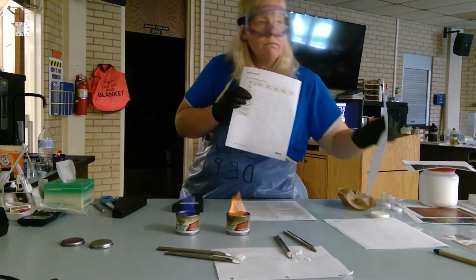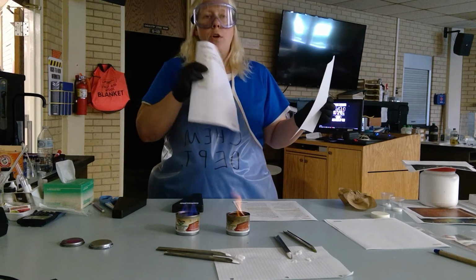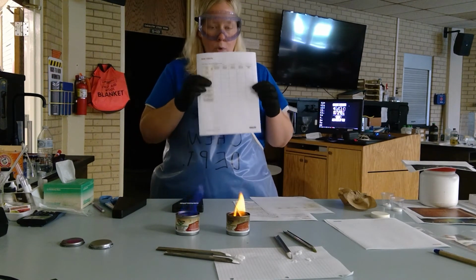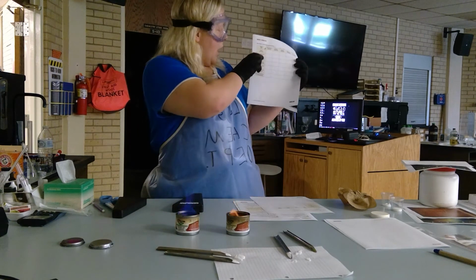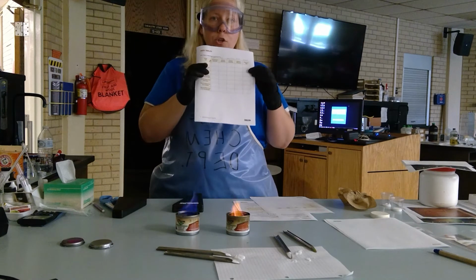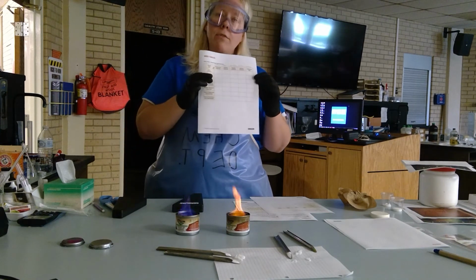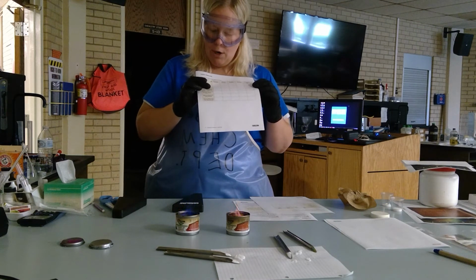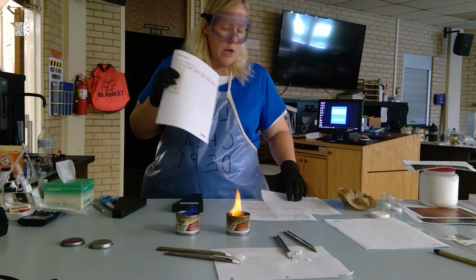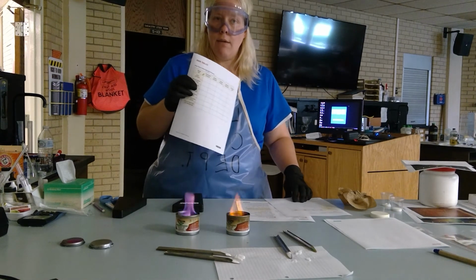In your lab, in your module, there is an equation on how to do this. There is a sample problem. I'm going to give you a spectrum line number, you need to use your calibration curve and determine what wavelength that will correspond to. Then you can identify what color that line should be.